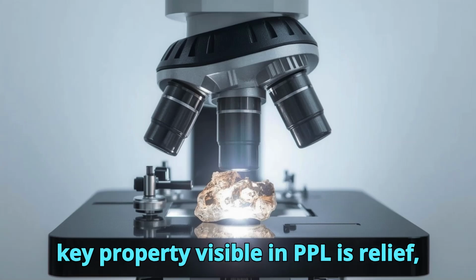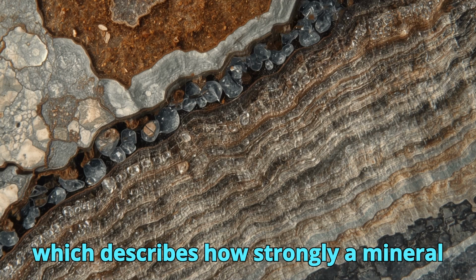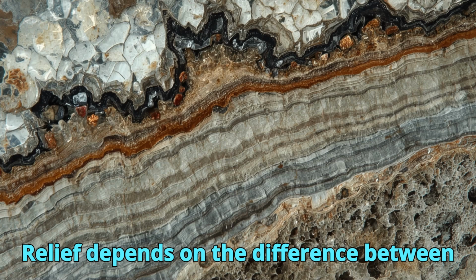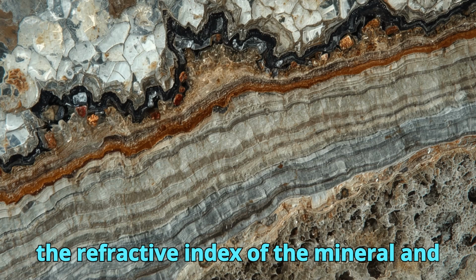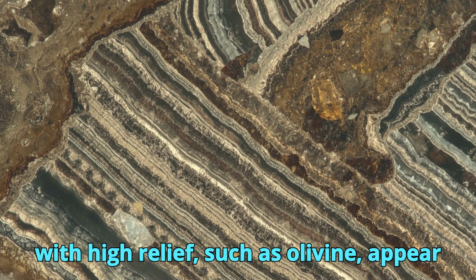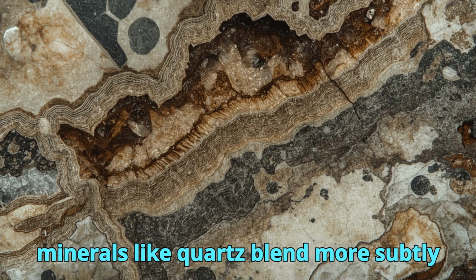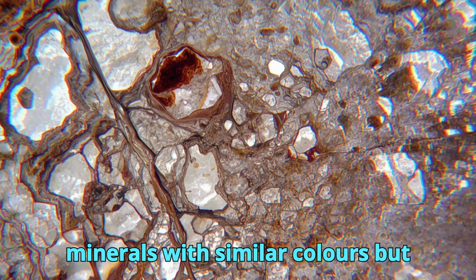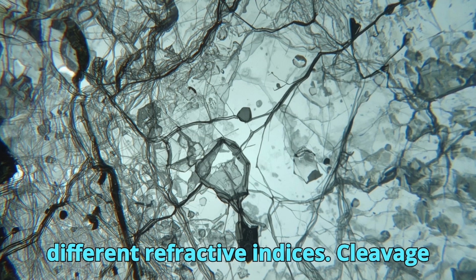Another key property visible in PPL is relief, which describes how strongly a mineral grain stands out from its surroundings. Relief depends on the difference between the refractive index of the mineral and that of the mounting medium. Minerals with high relief, such as olivine, appear sharply outlined, while low-relief minerals like quartz blend more subtly into adjacent grains. Relief is particularly useful for distinguishing minerals with similar colors but different refractive indices.